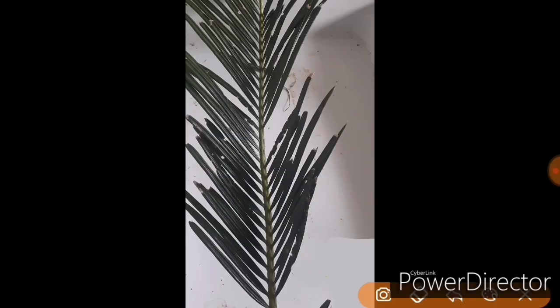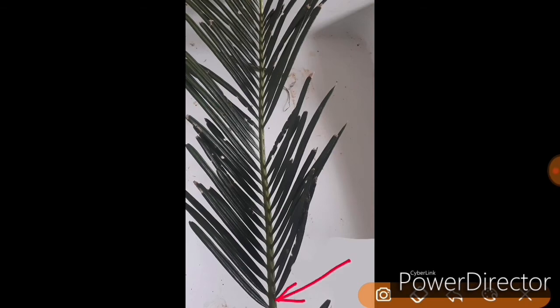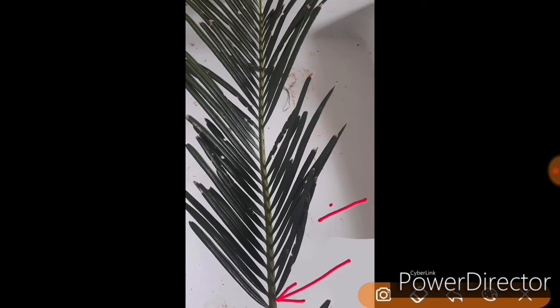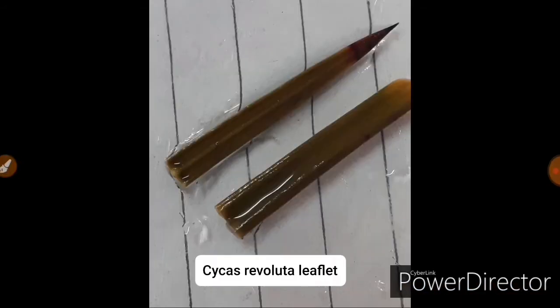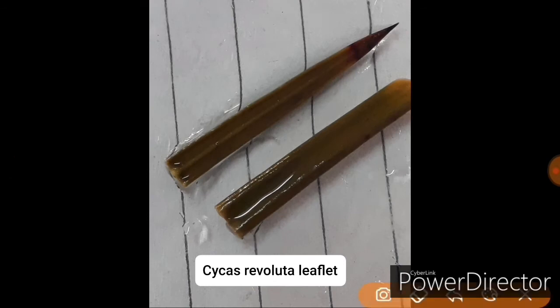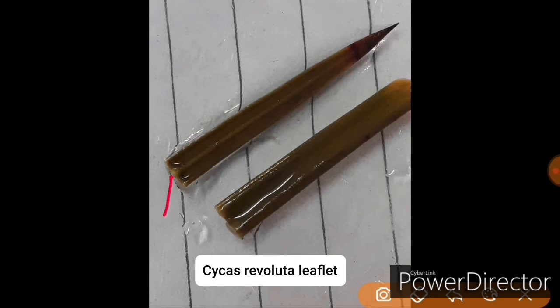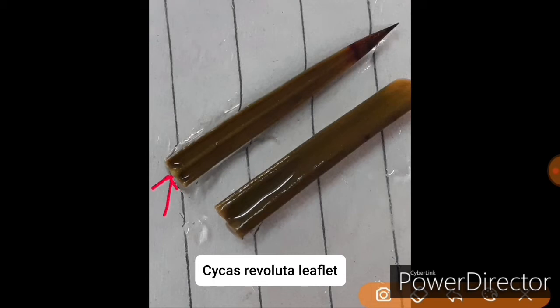This is Cycas revoluta leaf, which consists of a basal rachis on which leaflets are attached. These are basically the portions of the Cycas revoluta leaflet. As you can see, there is a single midrib which is slightly swollen. When you cut the section you will be able to see lots of cells, and I will show you how it appears on the slide.